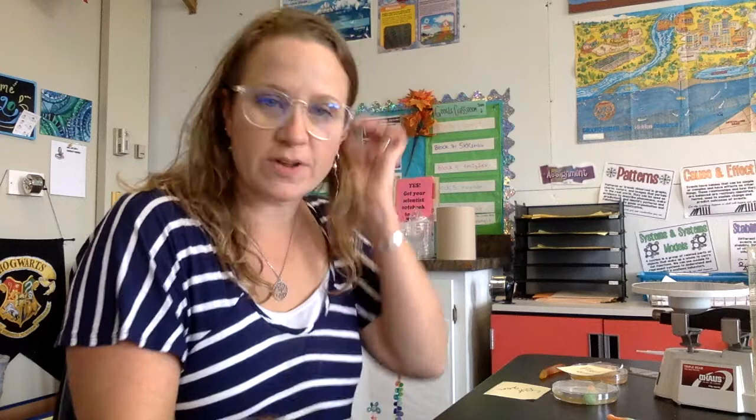Hey! So it's Mrs. Sutton and I'm going to go over the video that you need to do the Gummy Worm Lab. I'm gonna do a bunch of this for you, and don't worry, I still have gummy worms to hand out if I see you again. And if you're at home, this will be a way for you to just eat your gummy worms and then you can have this data. Our objective is to determine how the density of a gummy worm will change when it's soaked overnight in water, and we're gonna practice using the metric system.